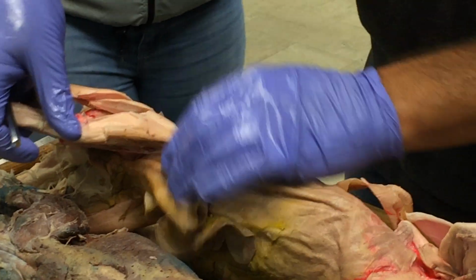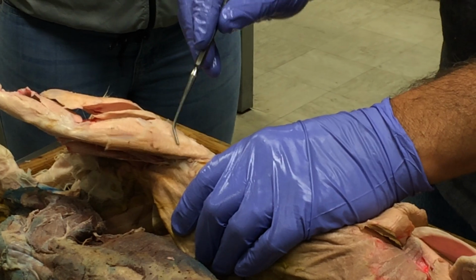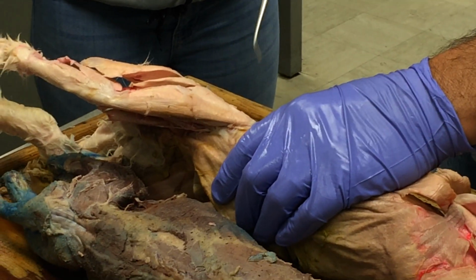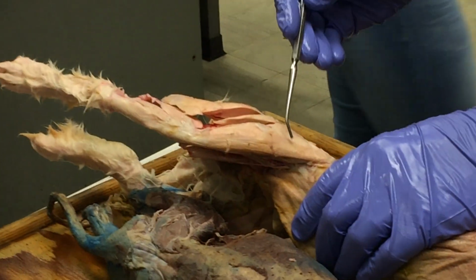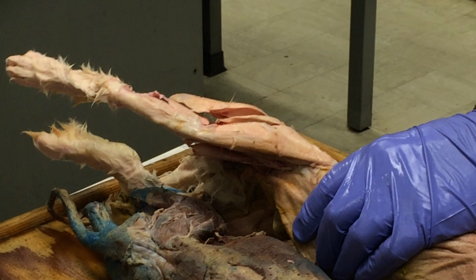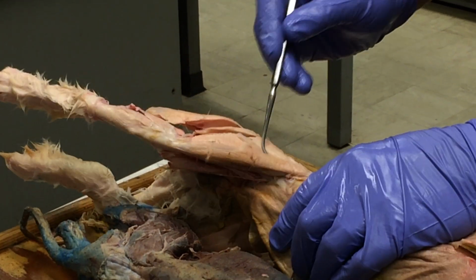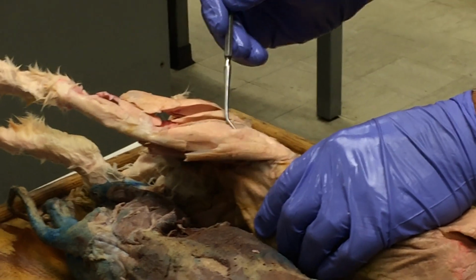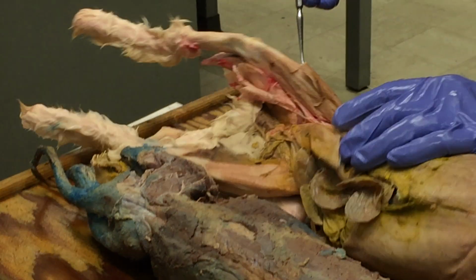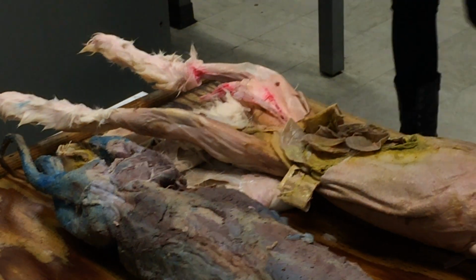And then on the rabbit, I guess it's on this side here, it's actually a really big and robust muscle. It's much bigger on the rabbit than on either the other ones. It's this one right here, and it's kind of confusing because it looks like it's in the place where the sartorius is in the cat and the mink, but this is the tensor fascia lati in the rabbit, and it's a big muscle, this whole thing here. Okay. And you can see fascia lata. Okay. Cool.